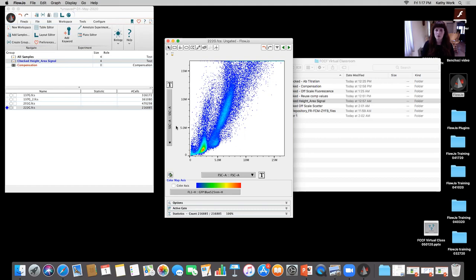Okay, so if I was thinking about that, what I would go through in my brain is to say, all right, well, let me do some initial gating. I'll gate on my scatter, I'll gate on my singlets, and if it works, even though it's saturated, is it okay? I'll show you really quick now.